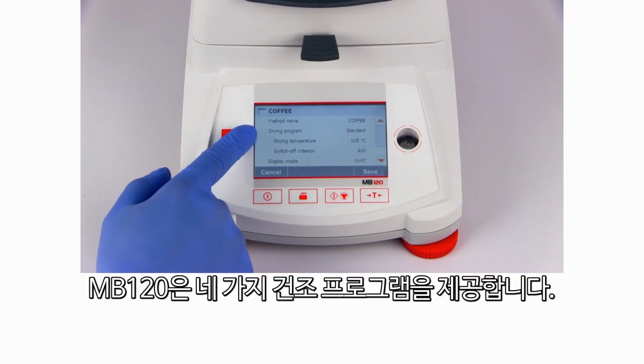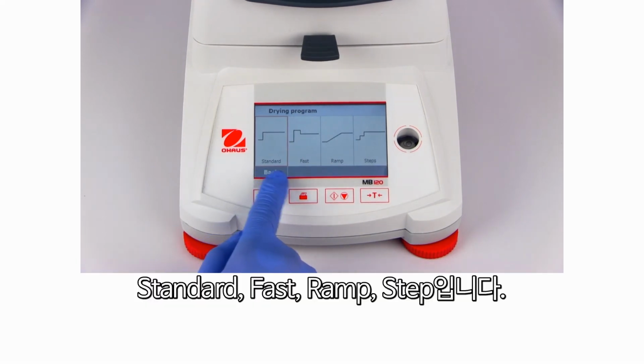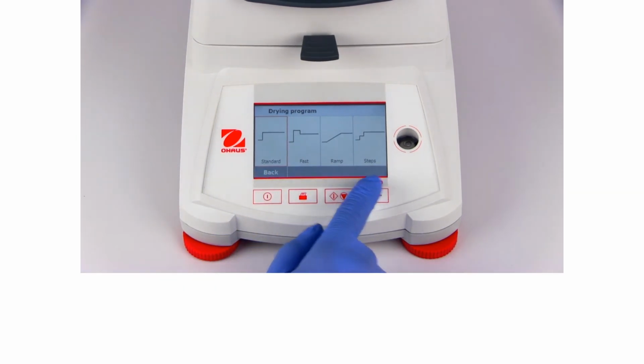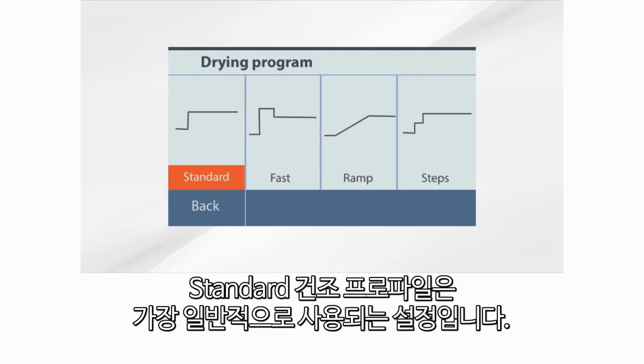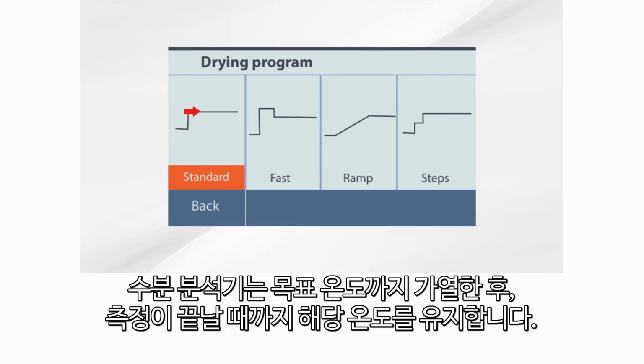The MB120 offers 4 drying programs: Standard, Fast, Ramp, and Step. The standard drying profile is the most commonly used setting. The moisture balance will heat up to the target temperature and hold throughout the test.